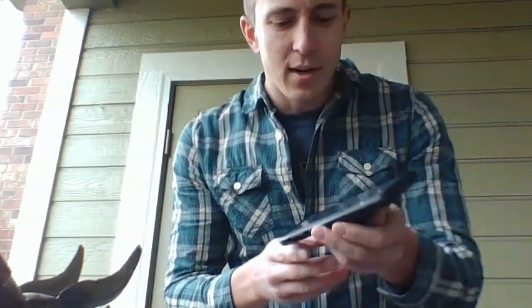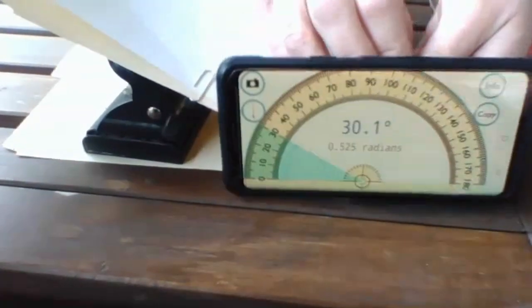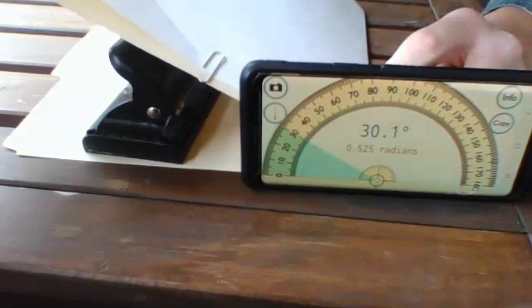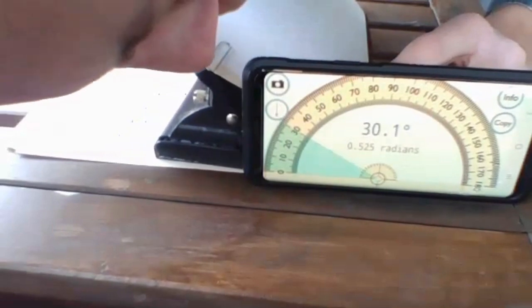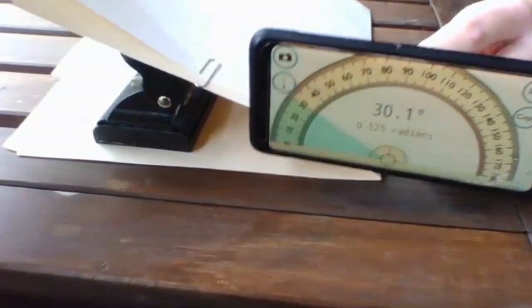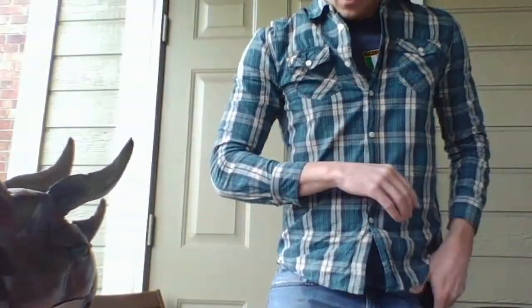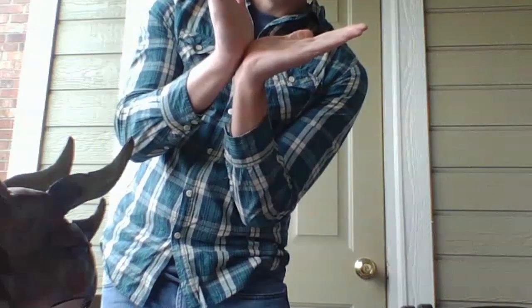Okay, cool. So what I'm going to do now is approximately hold this to the base of where my sheet of paper is. Now I'm going to move, in my case, this 3-hole punch until that angle about lines up with where it's at on my little protractor there, which looks like a little bit too high, so I'm going to move it down. That looks about right. And it's okay if it's not perfect. Really, all we need to do is get 9 different measurements between, again, 90 degrees and 0 degrees up here. Okay?